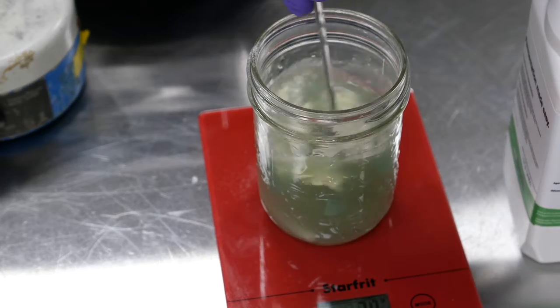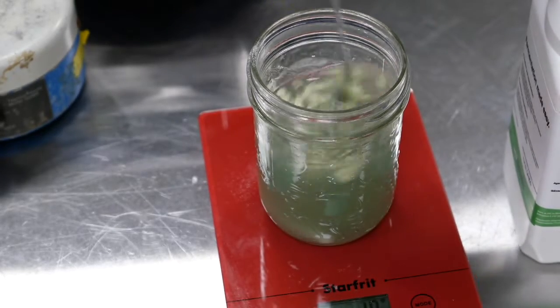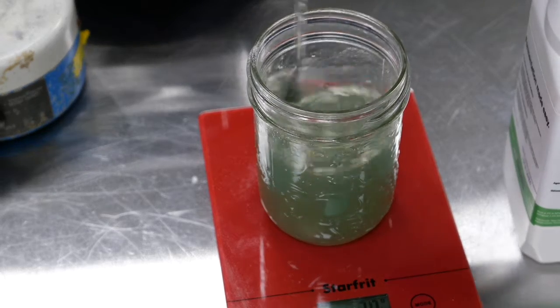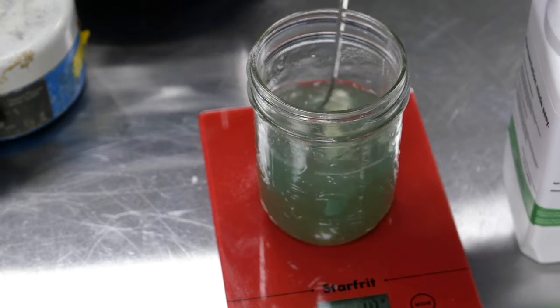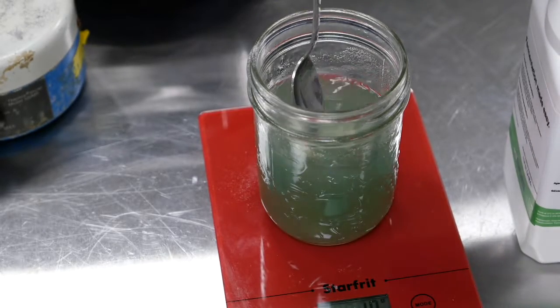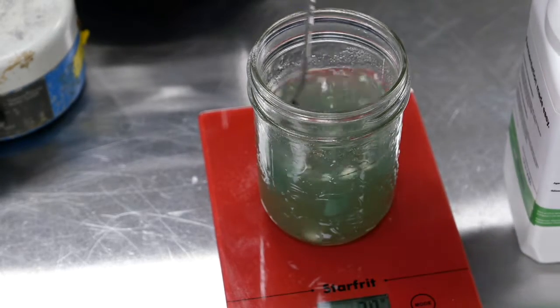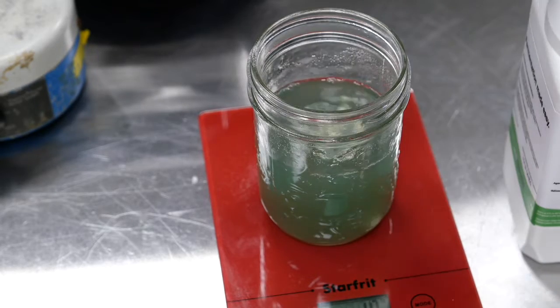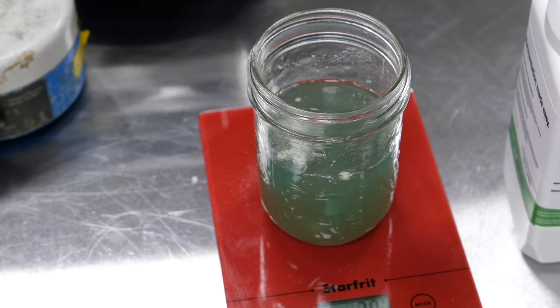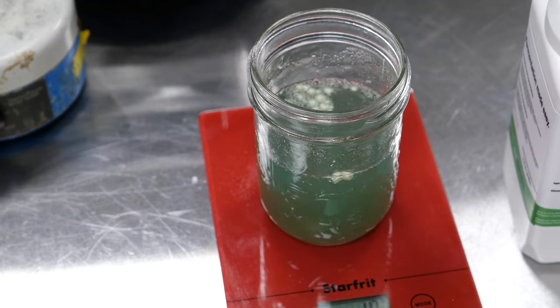And you can see, as it starts to dissolve, you can see the dye in the WLN. That's Bromocresol Green, a really cool pH indicator. When microbes grow on that agar plate, it's going to change color according to the pH. It turns yellow when the pH drops. It stays this really bright, vibrant blue if the pH does not drop.